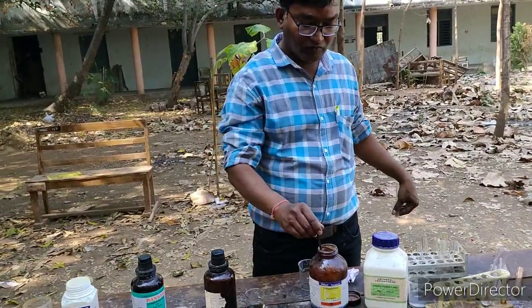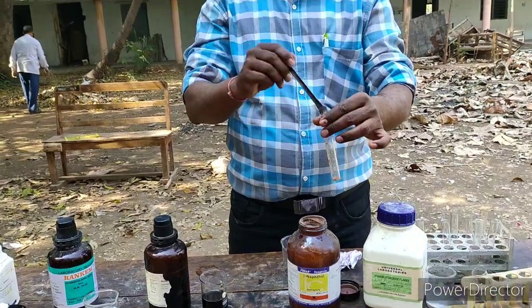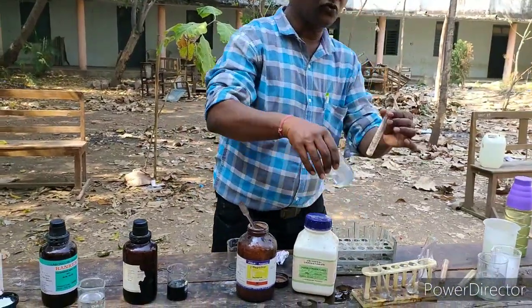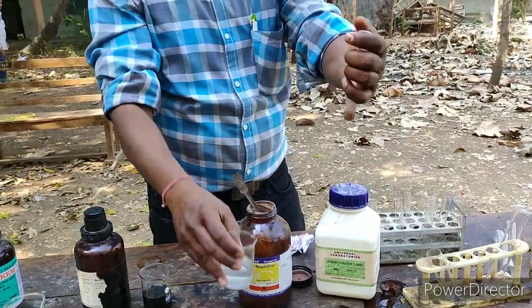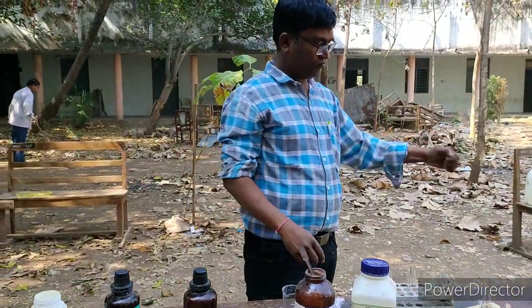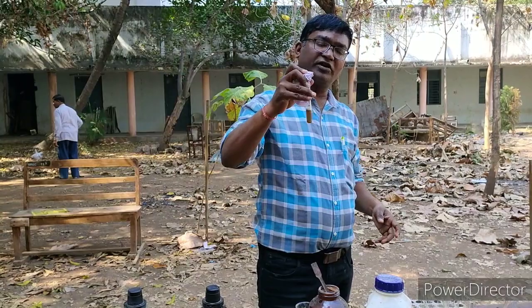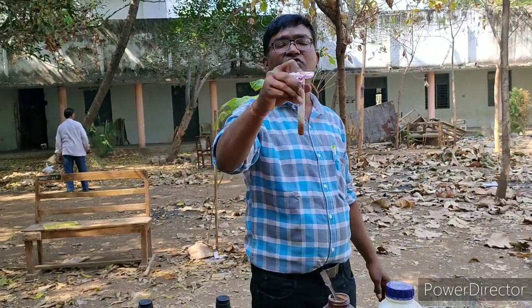We take beta-naphthol in another test tube. To this we add sodium hydroxide solution and dissolve it. To dissolve it, we cover it with paper and dissolve it in the sodium hydroxide solution.